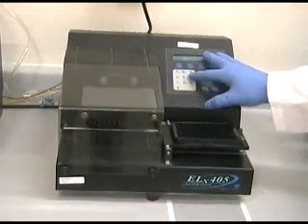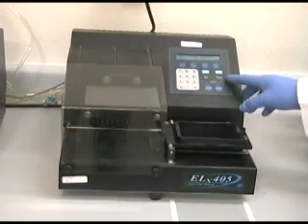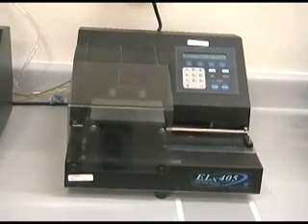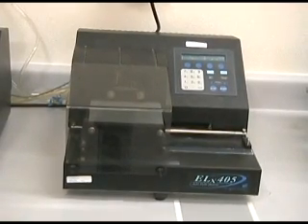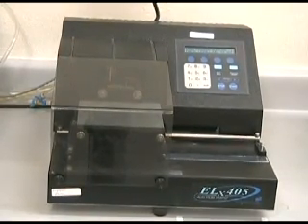Two different programs are to be run on the plate washer: dispensing and aspirating 100 microliters of wash buffer 3 times, and dispensing and aspirating 100 microliters of wash buffer 6 times. Make sure that the programs begin by aspirating the sample out of the plate before beginning the wash cycle. Prime the washer one time before each wash step.